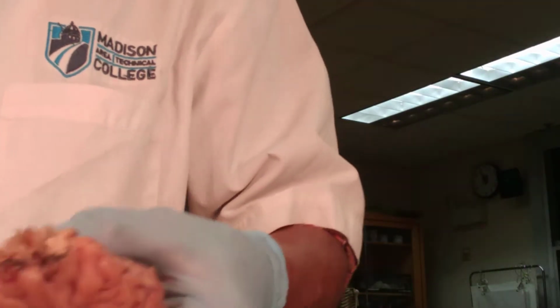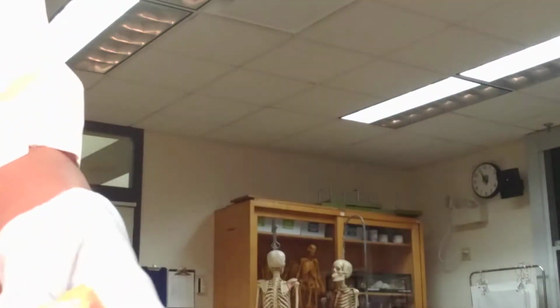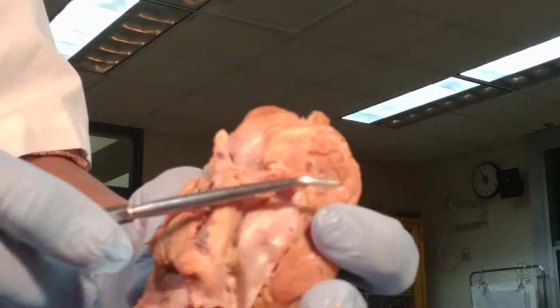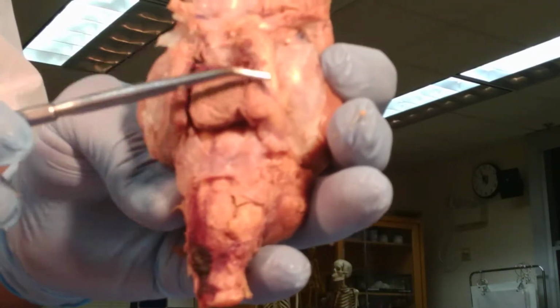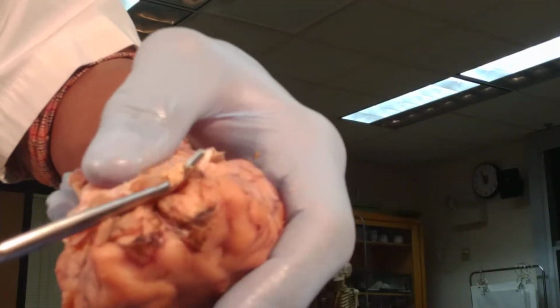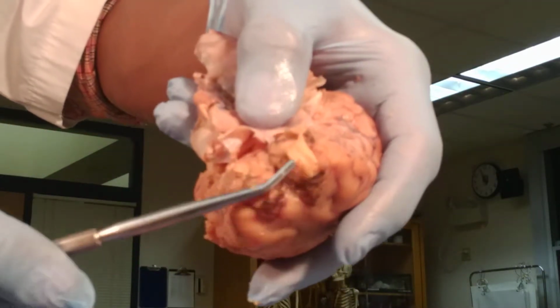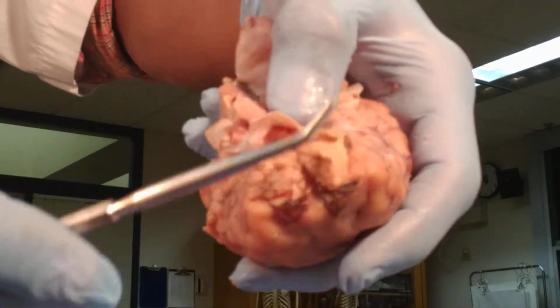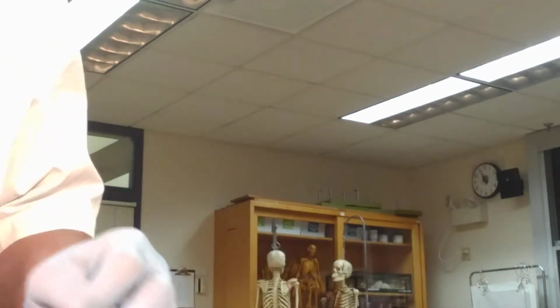Also, I am going to show you here the optic nerves and the optic tract. Let me use this here. After the optic nerves unite or cross here in the optic chiasm, they go as an optic tract. The olfactory bulbs will give rise here to the olfactory tract. This is part of the olfactory tract. This is one of them. The other one is removed or is gone. All right. So we are going to move to the next step.